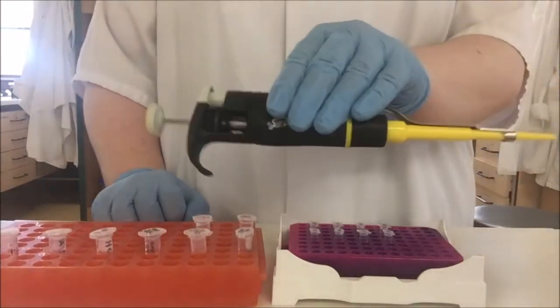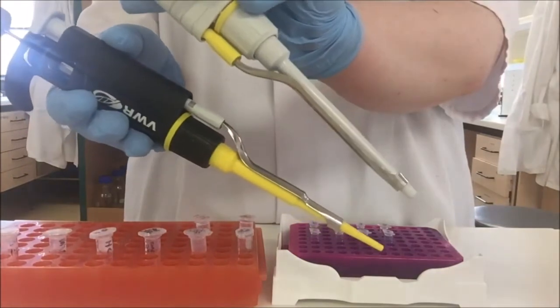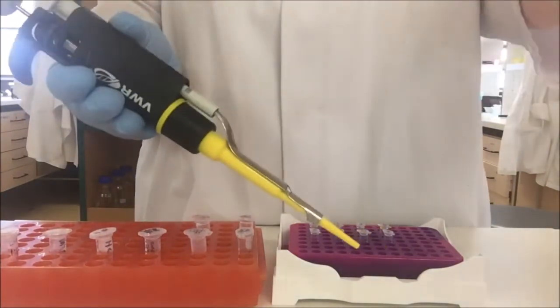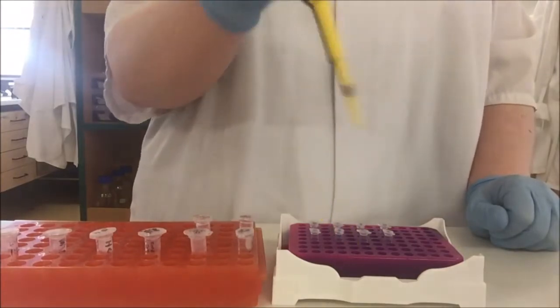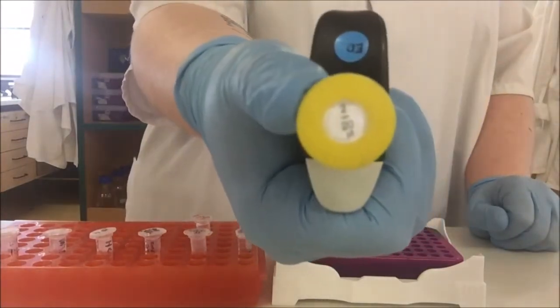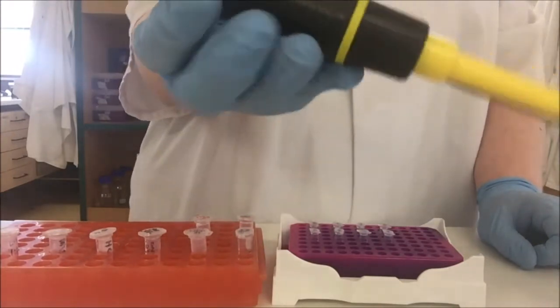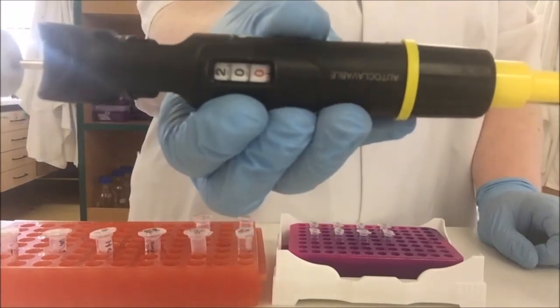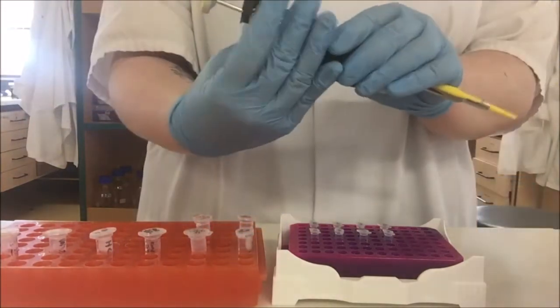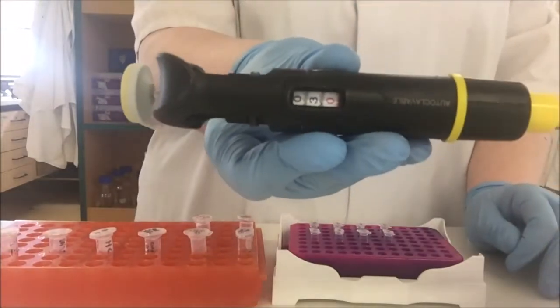I'm going to use a yellow pipette. But you'll notice this one has a narrow tip, where the previous ones you've been using had more of a blunt one. This pipette, instead of doing 20 to 200 microliters, does 2 to 20 microliters, which is stated on the top there. This pipette, when set to 200, you can see the second zero is red. So it's actually 20.0, not 200. First adjust this down to 3 microliters: 0, 3, 0.